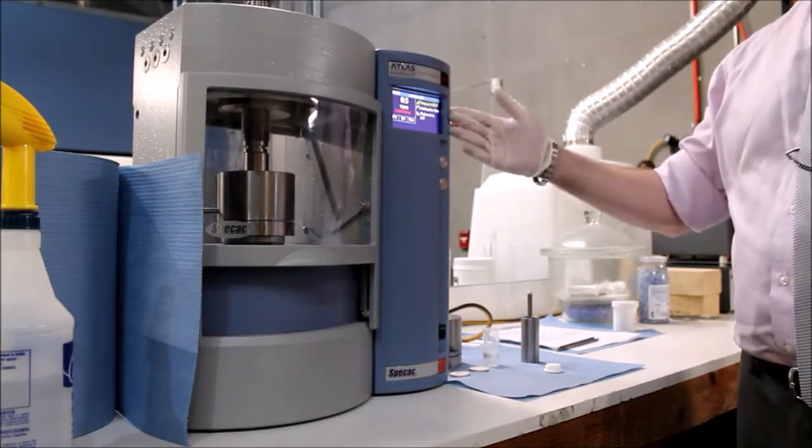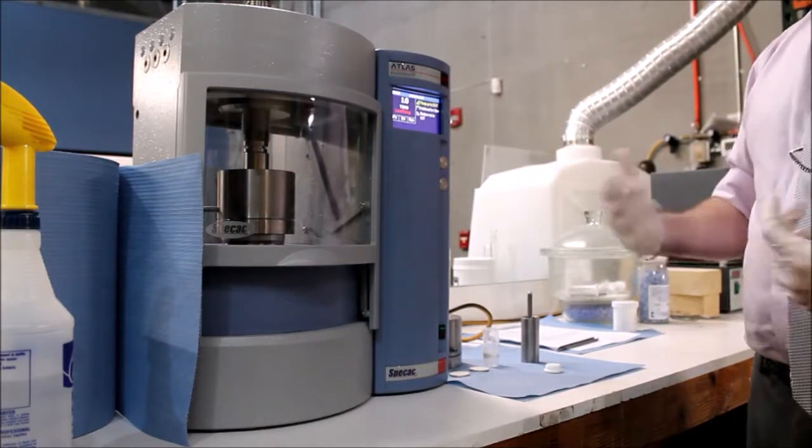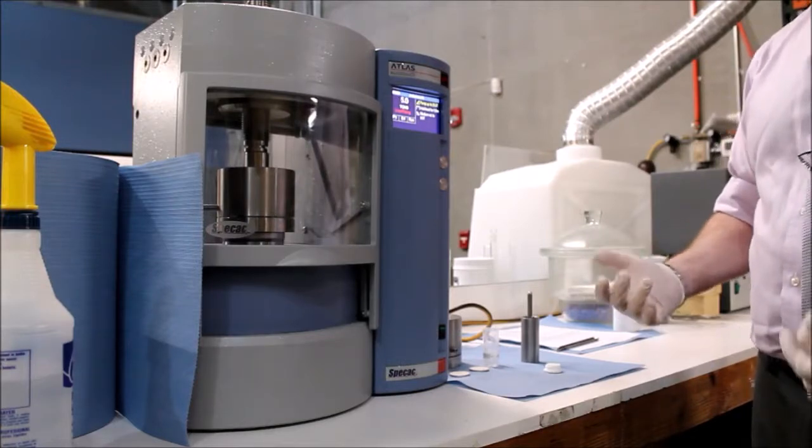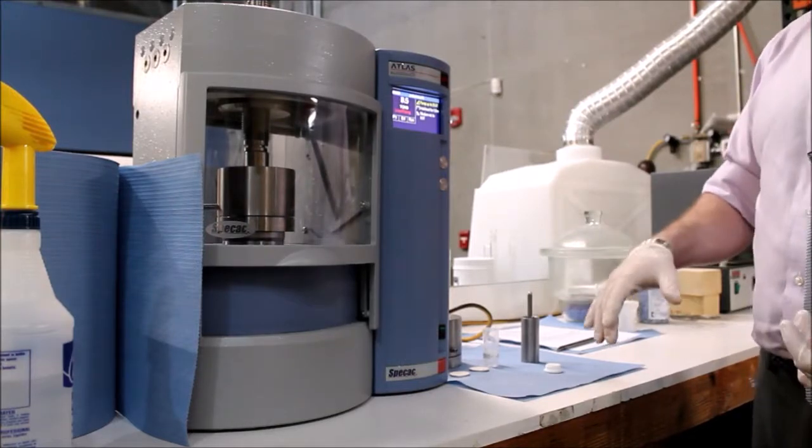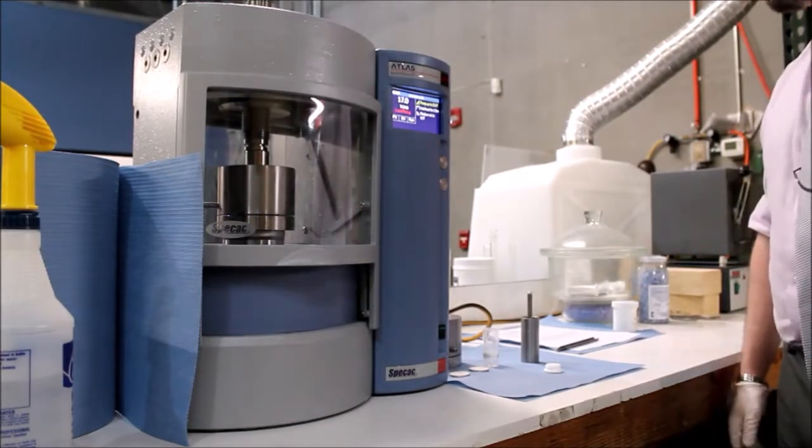Pressing the top button, the unit will begin the loaded program. It will state that the load is rising, and if a timed component is programmed, once the timer has reached zero, the unit will then release the pressure from the die set at the programmed rate.